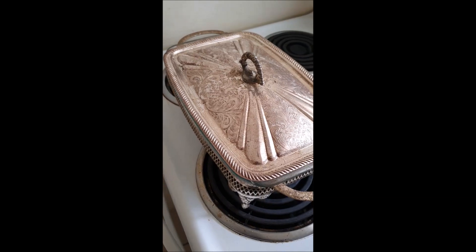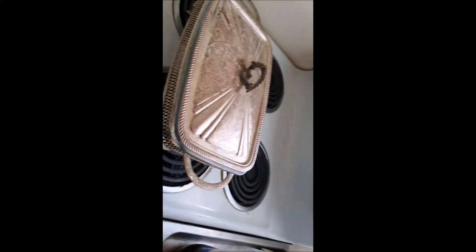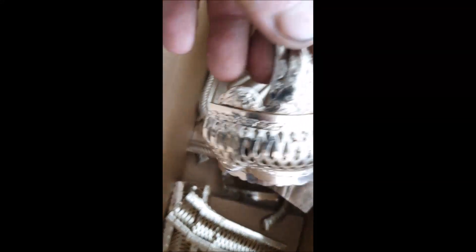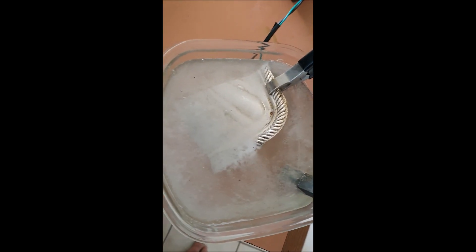I'll give you a look. What I have here — I've got two of these. I've already cut one up and left one to show you. The lid is silver plated, then we've got a glass bowl and then we're left with the frame. I've already chopped one up into bite-sized pieces — just small enough to put them into the vinegar and salt.